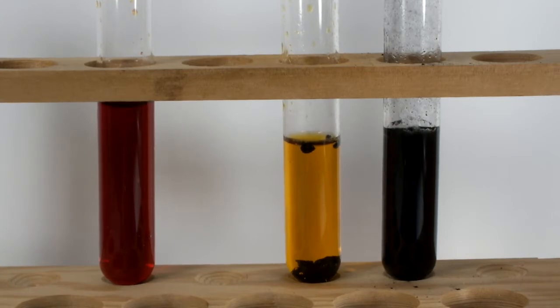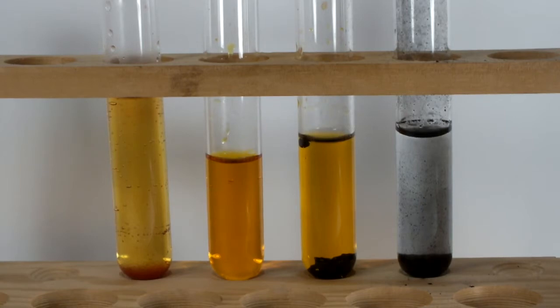I left all of them sit for about 2 hours so the carbon could settle out, and during that time the nitric acid tube did some interesting things. By the time I came back, I had added a control tube in the number 2 position, which remained untreated for comparison.